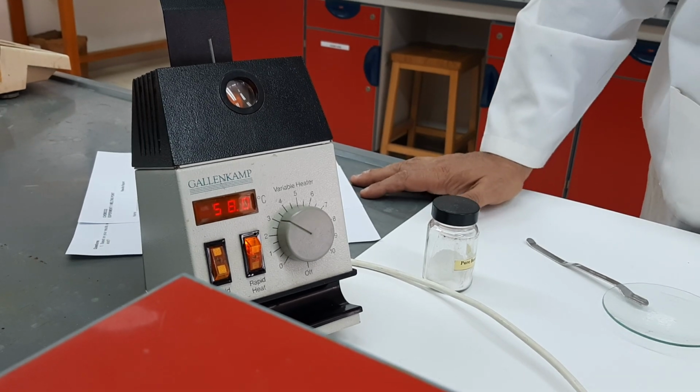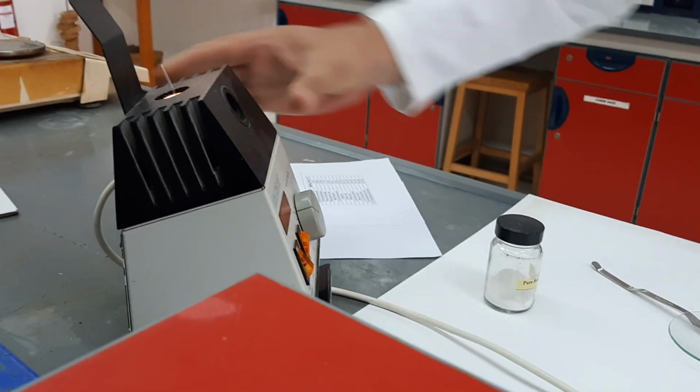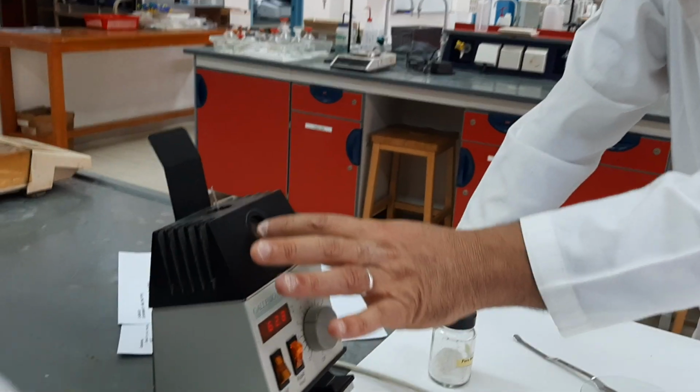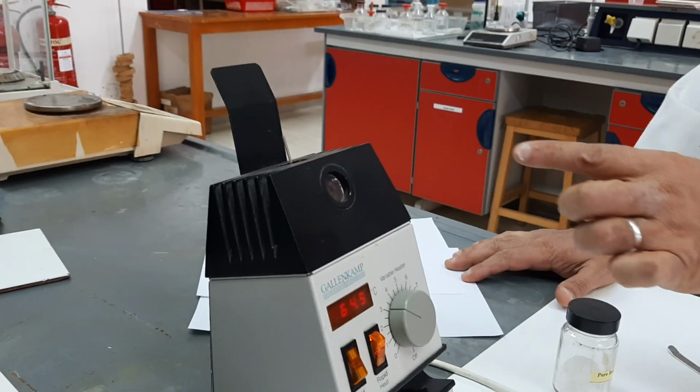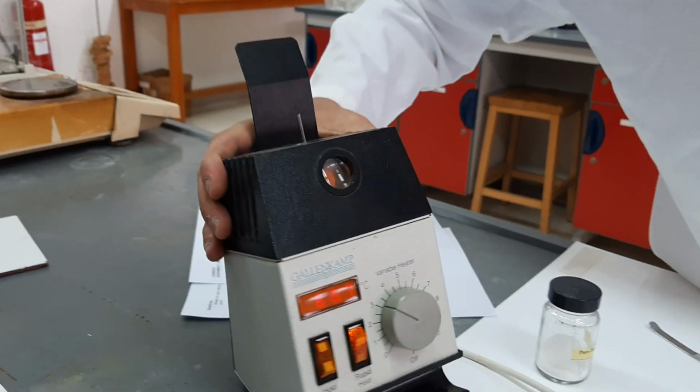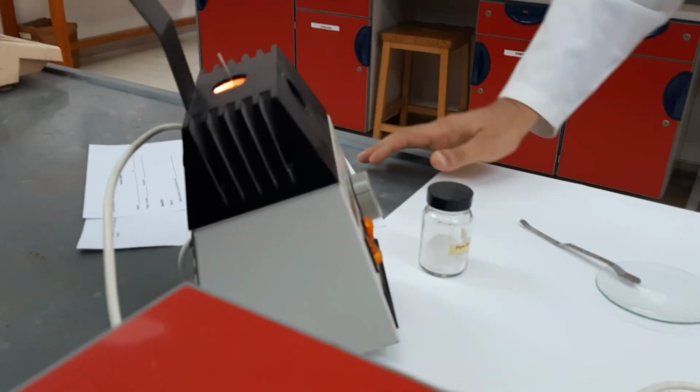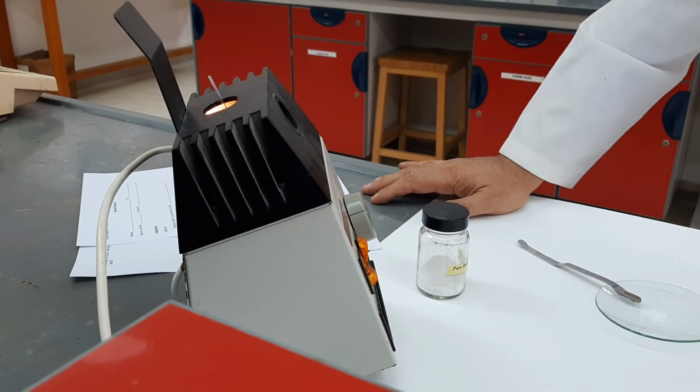In here, we will always keep our vision on this mirror, this lens here, in order to see what's going on. I don't know if you can see it, and if you can bring it closer. Can you see through the lens? Can you see the solid inside the lens? Because of the light, it is not possible. Anyway, what you have to do is keep looking and watching what's happening.